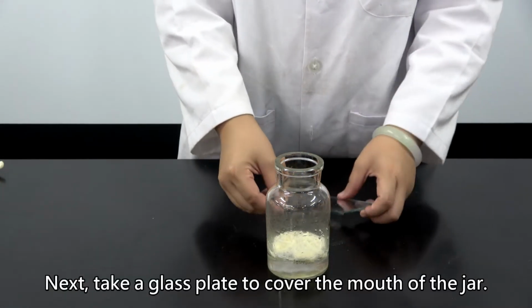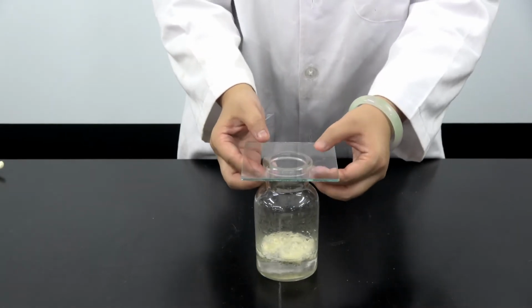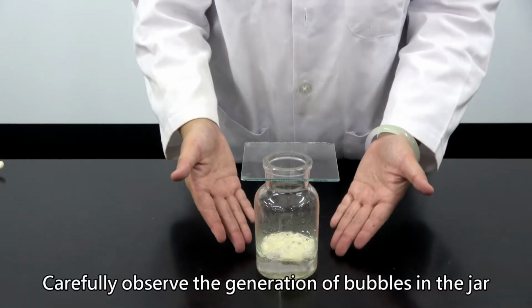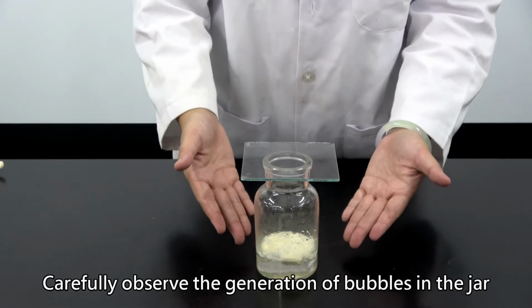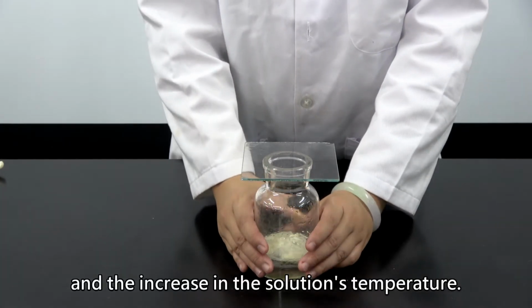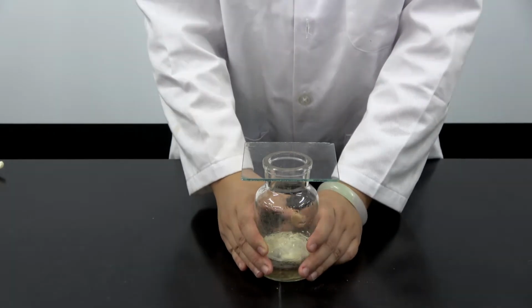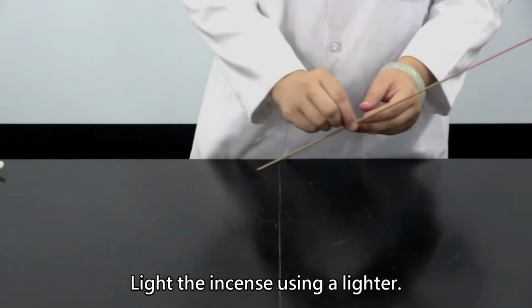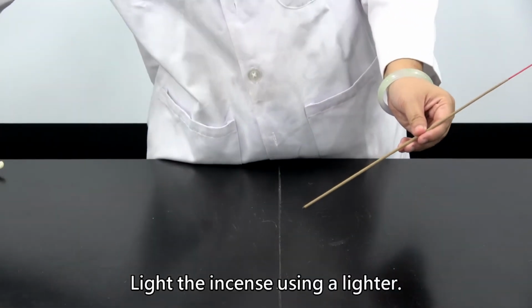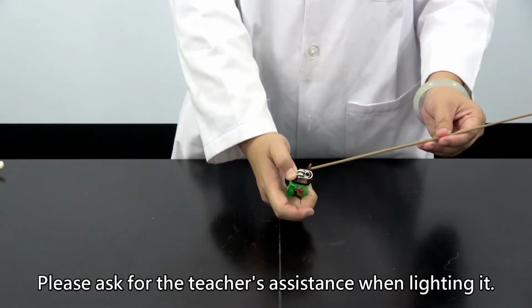Next, take a glass plate to cover the mouth of the jar. Carefully observe the generation of bubbles in the jar and the increase in the solution's temperature. Light the incense using a lighter. Please ask for the teacher's assistance when lighting it.